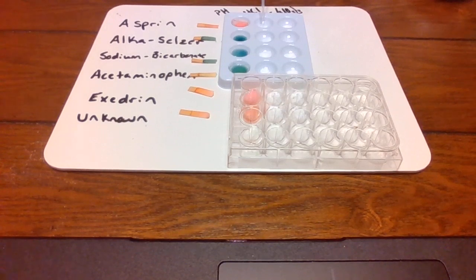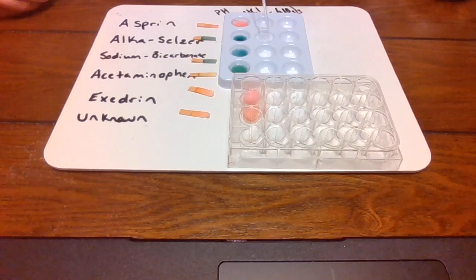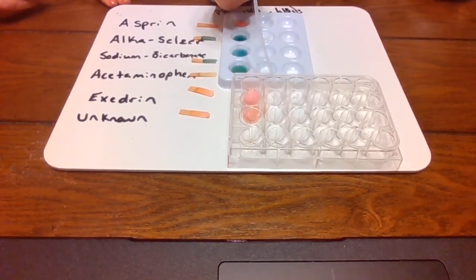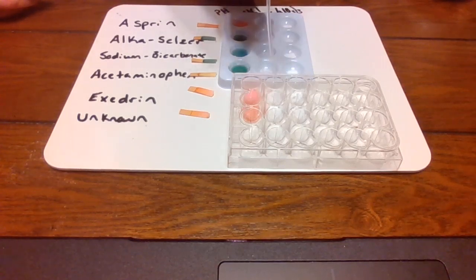Keep putting it. You don't have to be afraid of it. Push it till you can see some liquid. There you go. Next one. Oh, that one's having a reaction. Fizzing. Oh, a little bit of fizzing. Whoa, a lot of fizzing. Okay, not really much happening. Now you have these two right here. Next, don't touch it. Just put it in there.